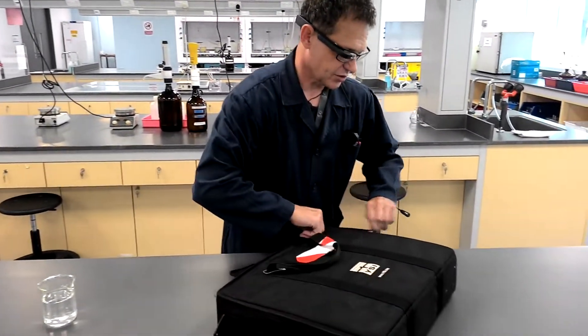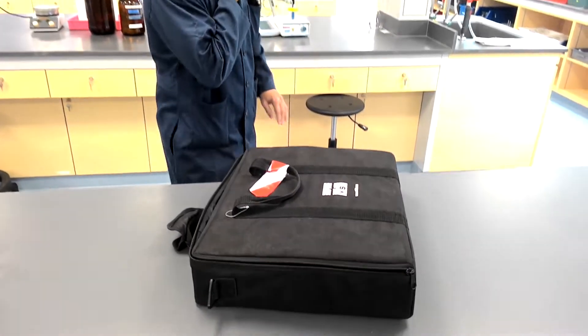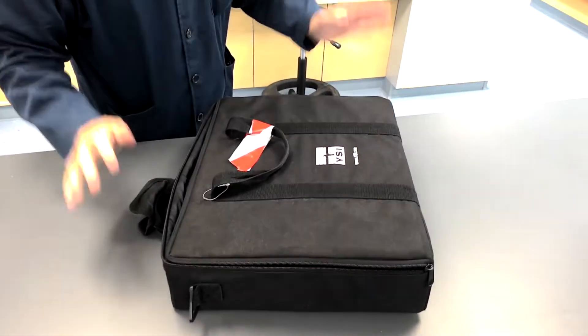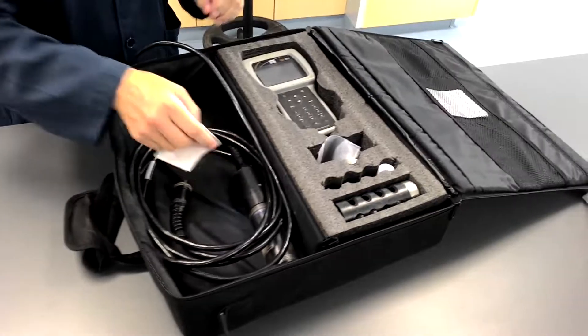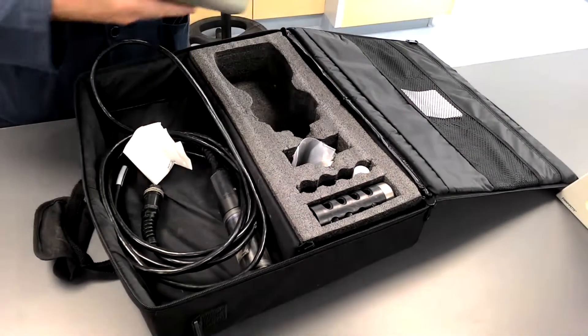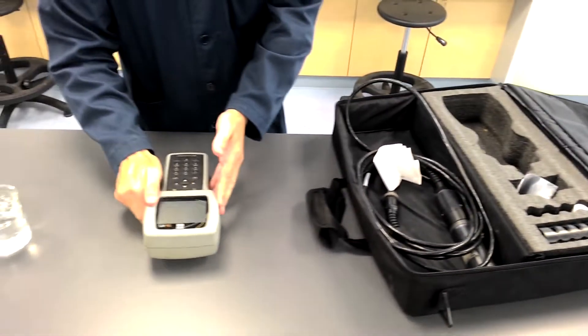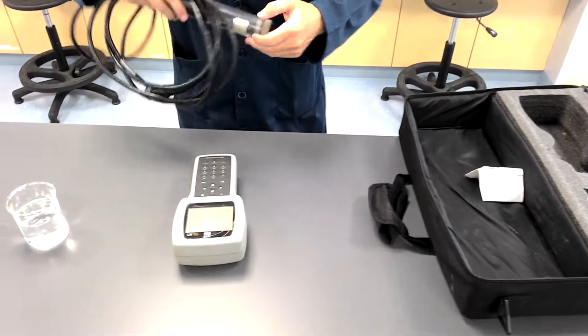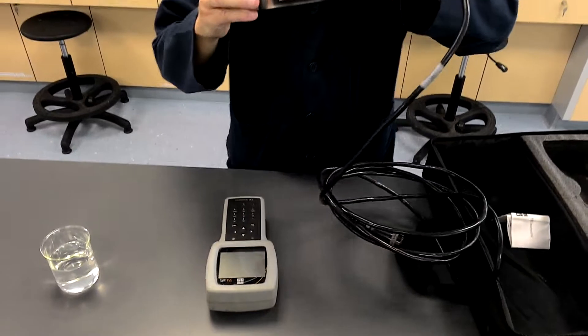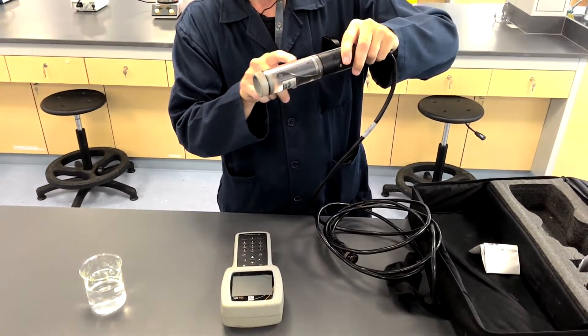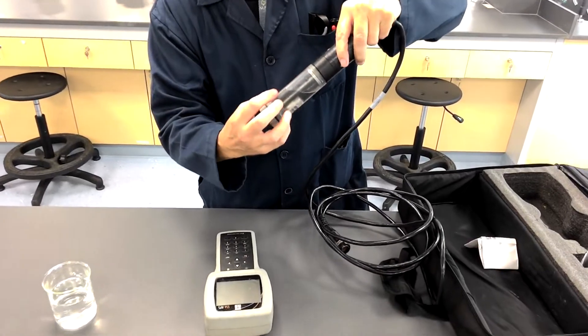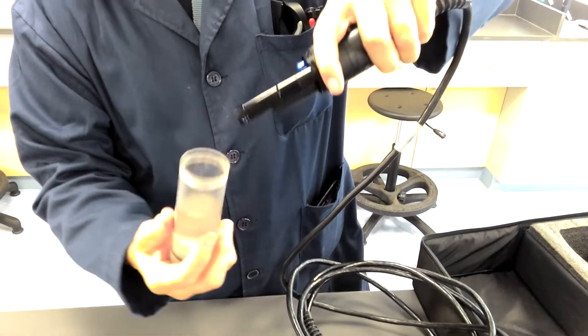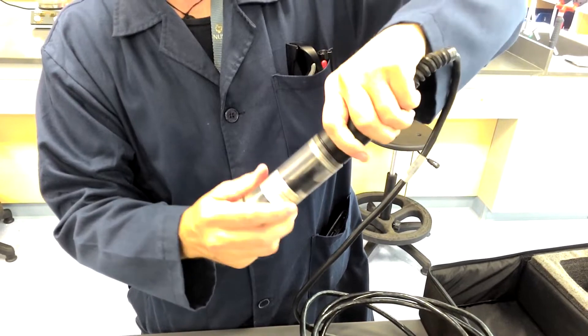Okay, so many different types. This is just one of them. And we have the main body of the meter. And we have the probe itself. And you can see that the probe, the dark colour in there, is actually in a detachable guard, almost like a beaker of water. I'm going to put that back for a moment.